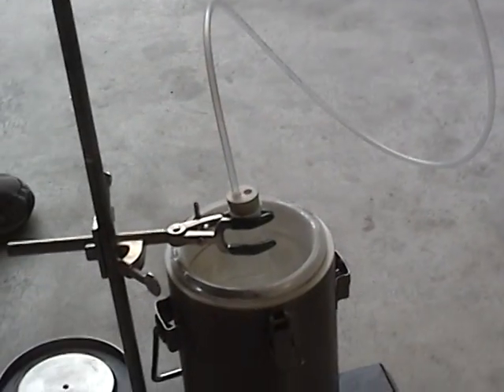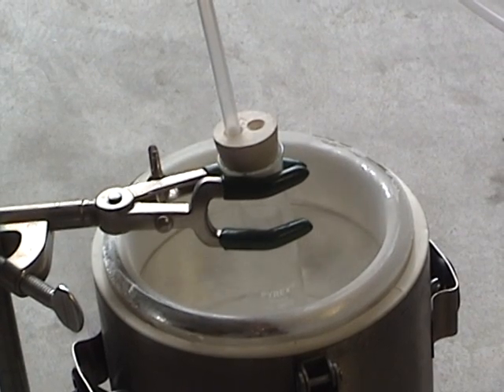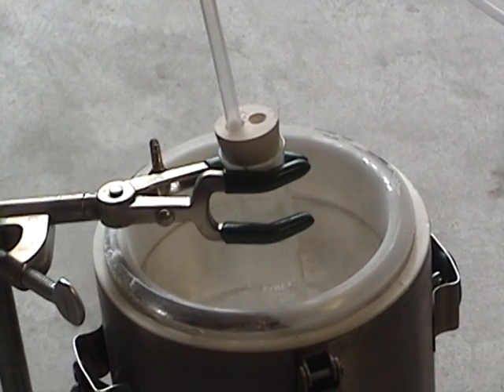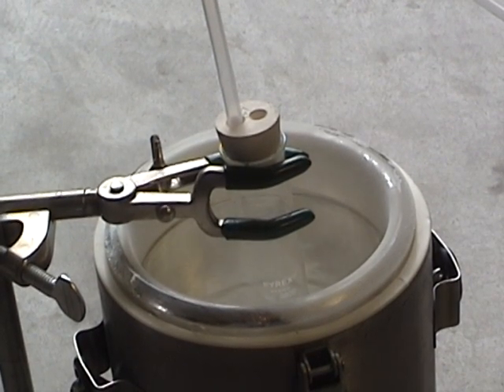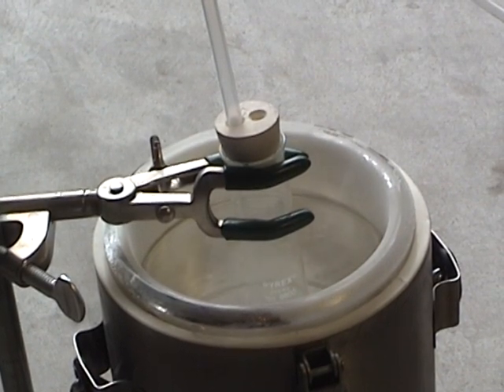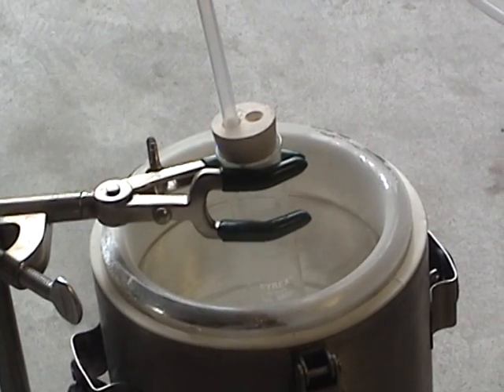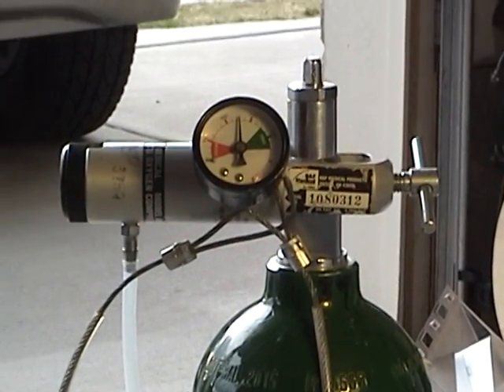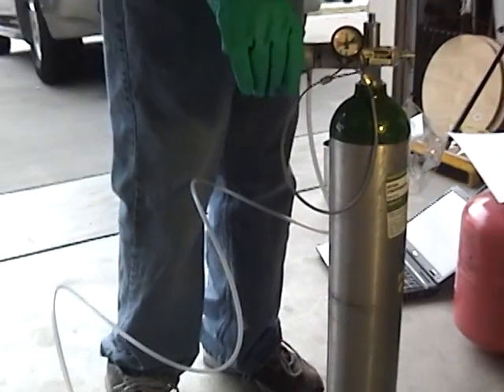You can probably hear it going in. I'm just going to take a few seconds — probably more like 30 seconds — to get about maybe a milliliter in there or so. That's probably about good. I'm going to turn off my oxygen.